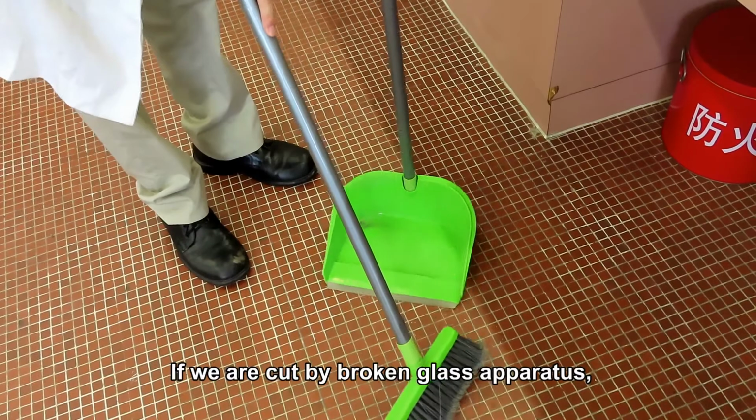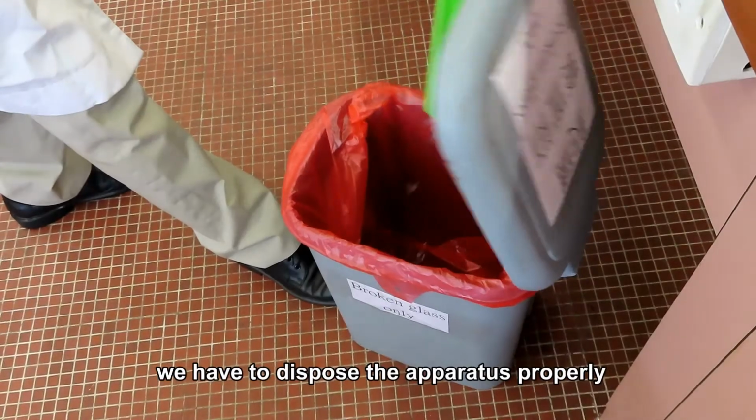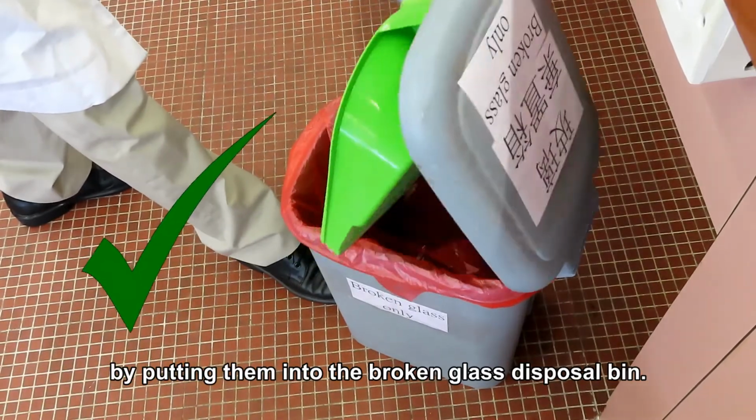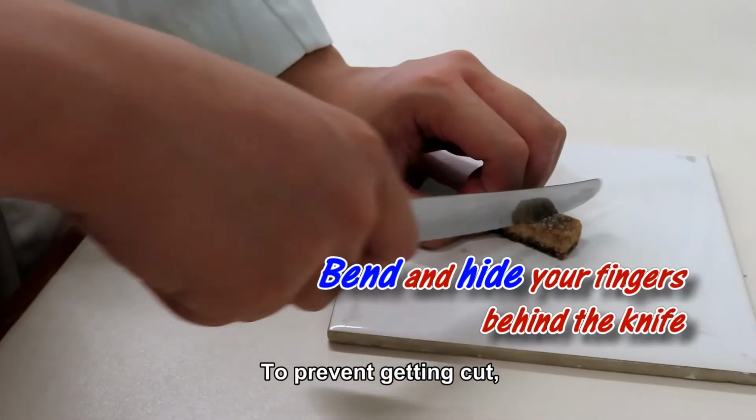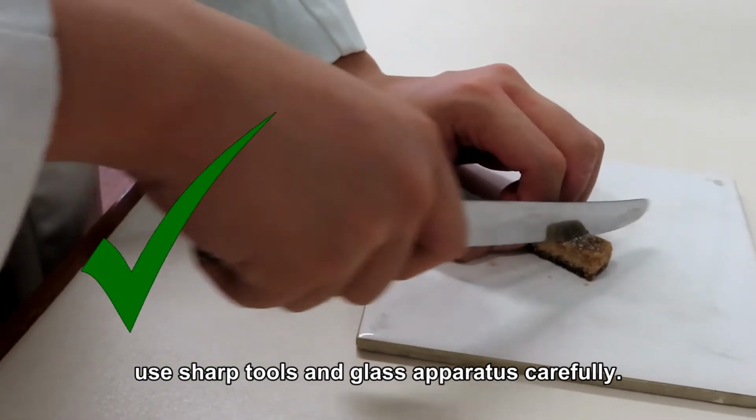If we are cut by broken glass apparatus, we have to dispose of the apparatus properly by putting them into the broken glass disposal bin. To prevent getting cut, use sharp tools and glass apparatus carefully.